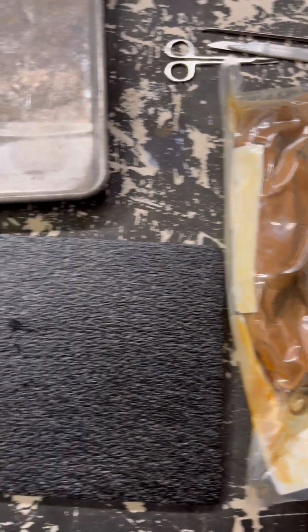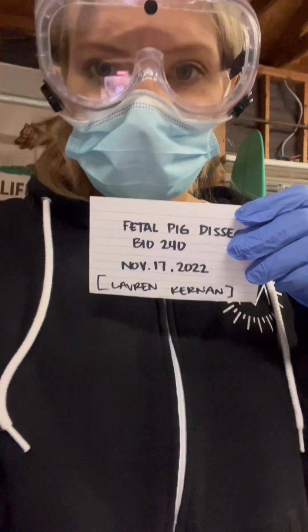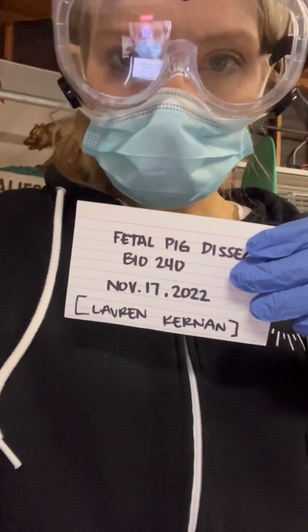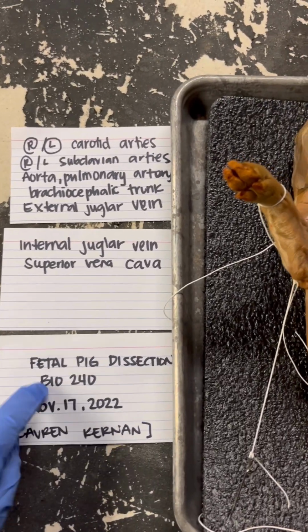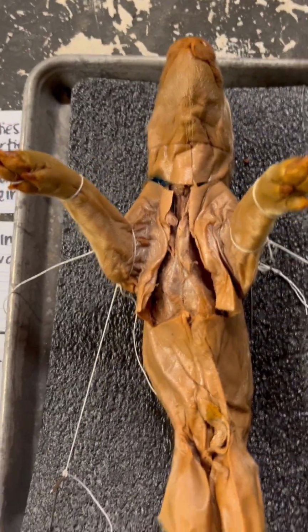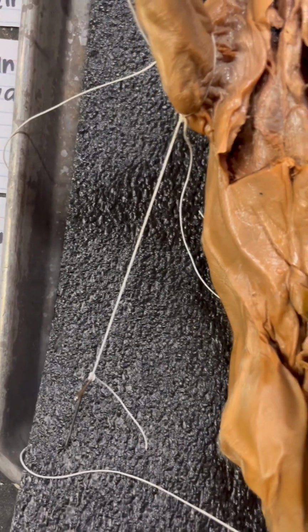So we have everything we need here, and I'm going to go ahead and get this set up, and then I will flip the camera back around. Okay, we're all set up. I'm just going to flip the camera around because I have set up the pig and dissected it. I will point out all the things that we need to list. Here I just have my name and everything I need to point out. And here is our pig.